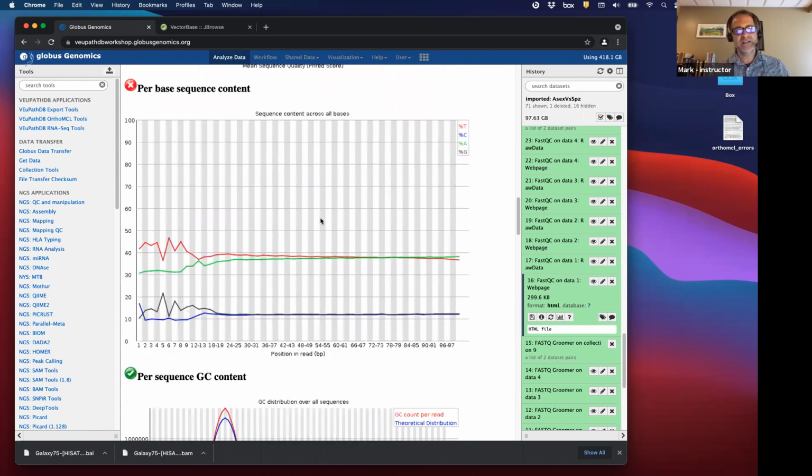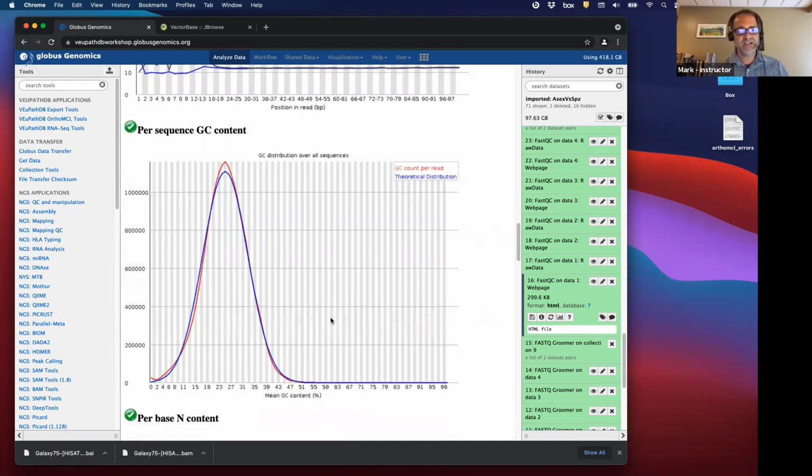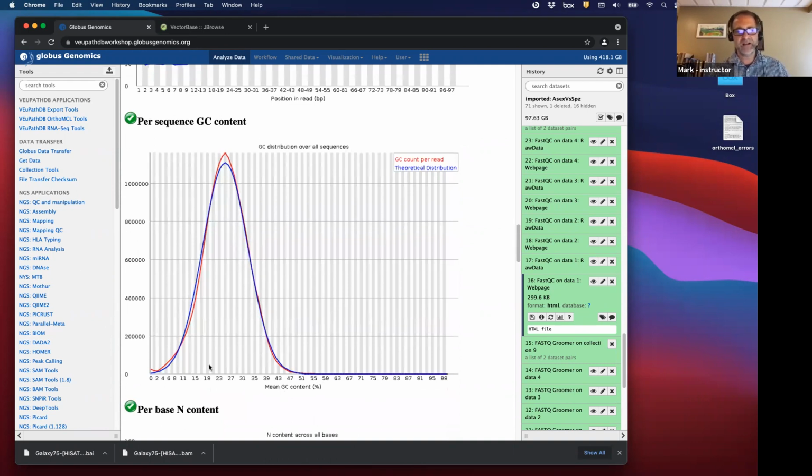Per base sequence content, you would expect the amount of A to equal the amount of T, because they pair in DNA, and that usually is what you see. So the amount of A is the amount of T, and the amount of G is the amount of C. And that's good. If you don't see that, it's possible you're contaminated with RNA, which is not pairing, right? So you're not going to have an equal amount of T and A necessarily in RNA. Per sequence GC content, this usually is one peak. If you end up seeing a bunch of peaks, that may mean you have contaminating material like RNA or even bacterial genomes or other things in there that have a different GC content.